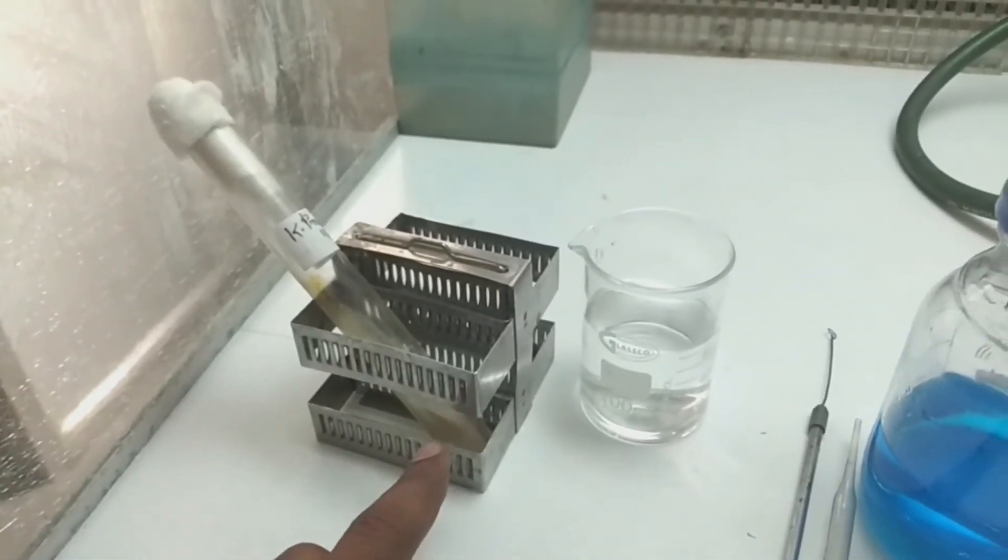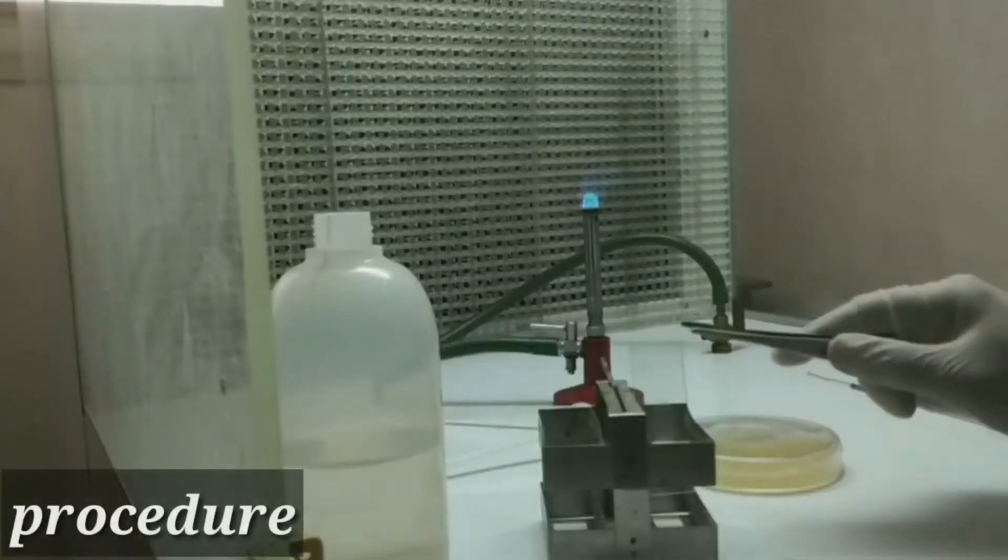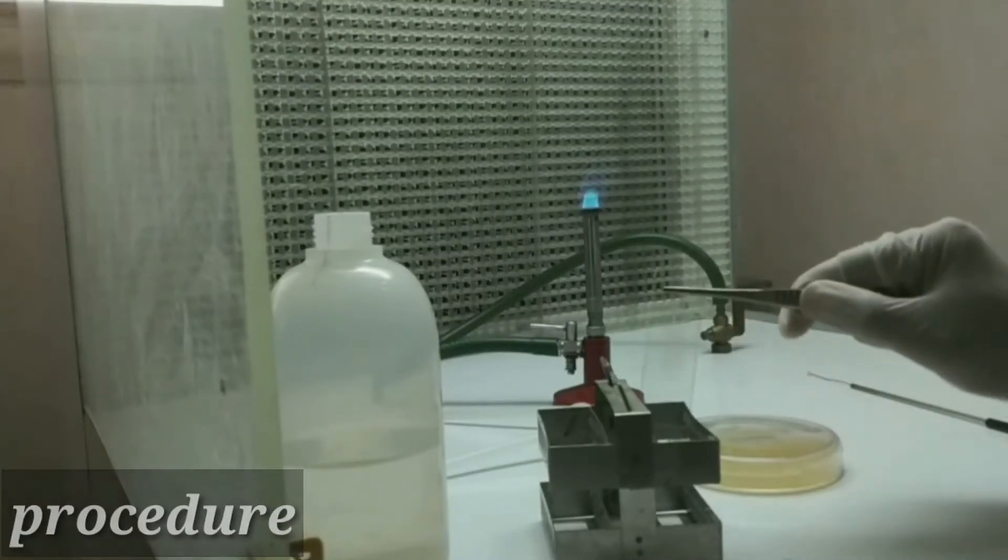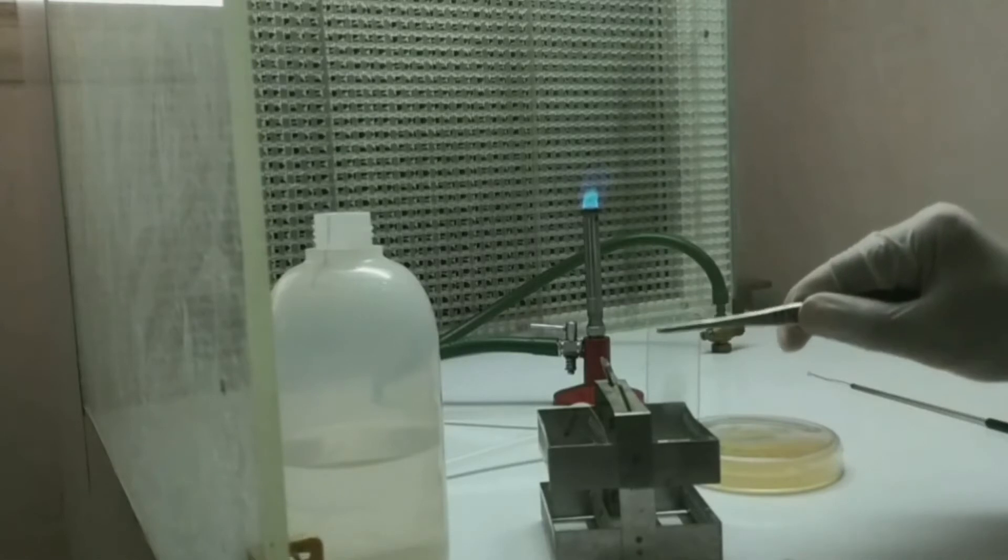Firstly, you just have to make a smear, but keep in mind that you don't have to heat fix the smear, as heat fixing will melt or destroy the capsule.